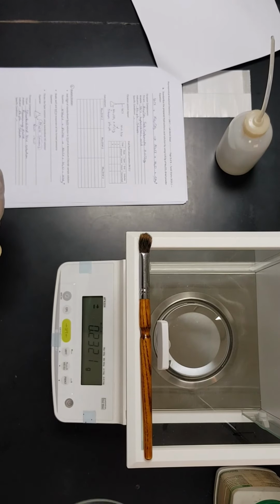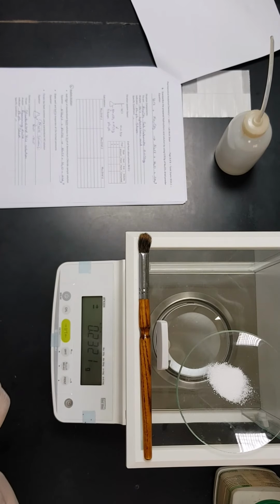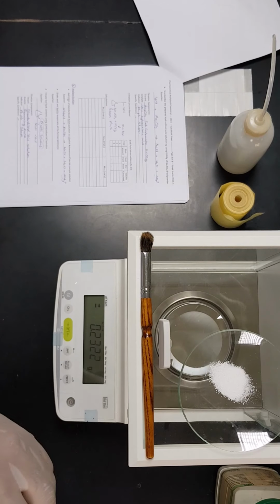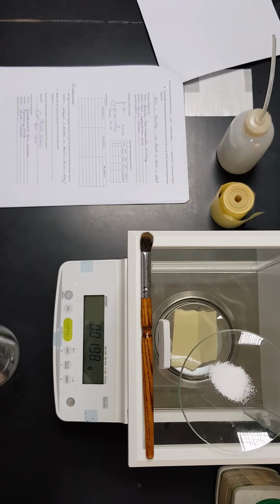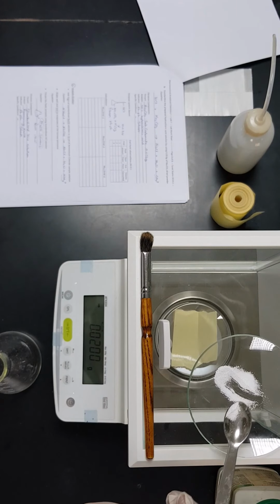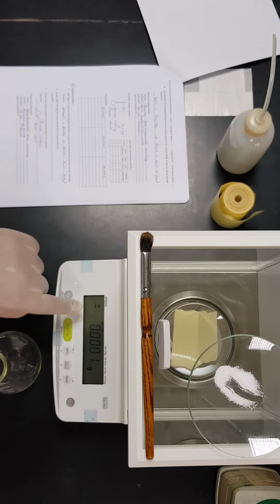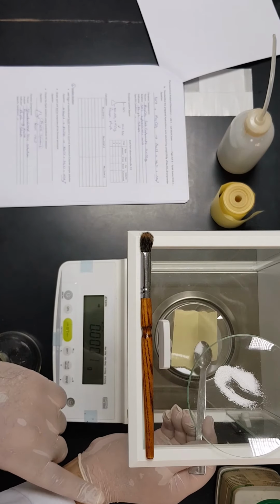Now we have sodium carbonate after being heated in the oven. Now we're going to take from that amount the exact contents we need to standardize the prepared HCl solution, and this is our conical flask. So from this amount we're going to take 0.053 grams. First of all we have to make sure that the balance is stable. 0, now it's stable. As I told you, we have a little drifting in that balance, but it's okay.